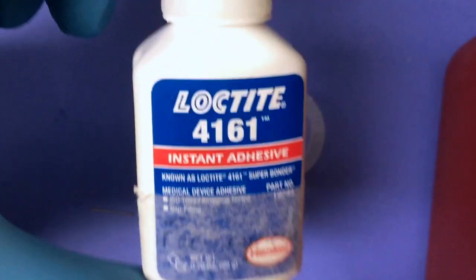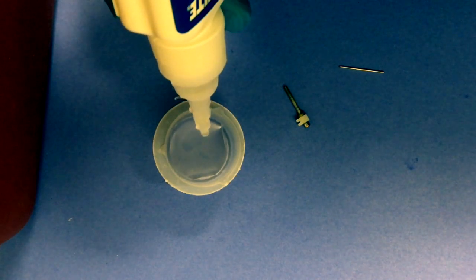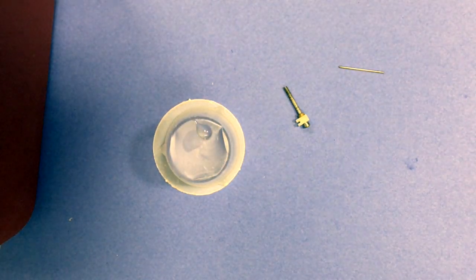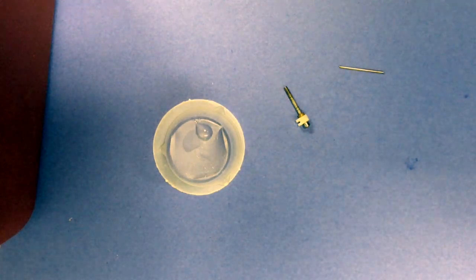Take note of the special Loctite glue we use for gluing purposes of the Tetrode carrier. In order to actually apply the glue, you can use an old piece of cannula that is not being used or is bent in any way.